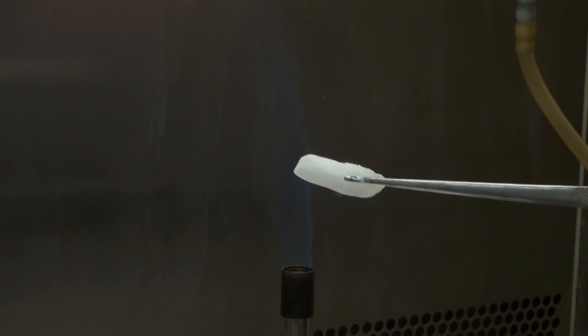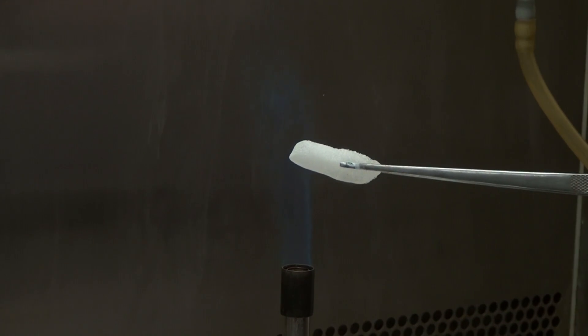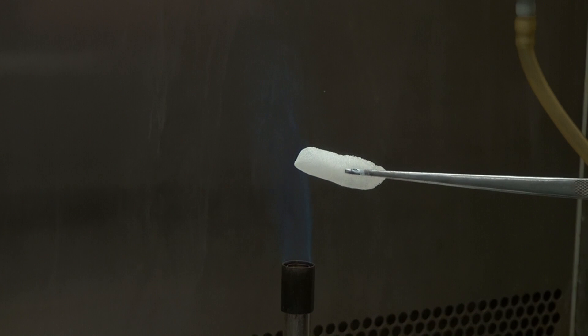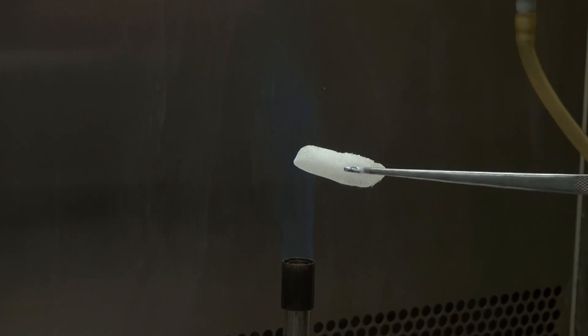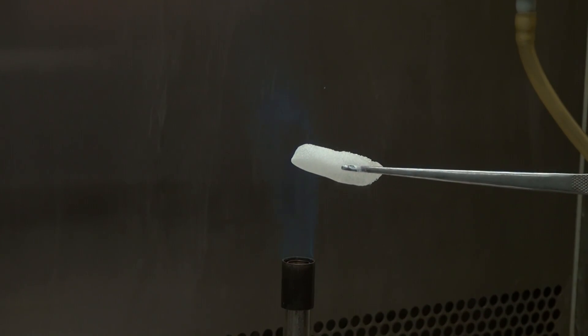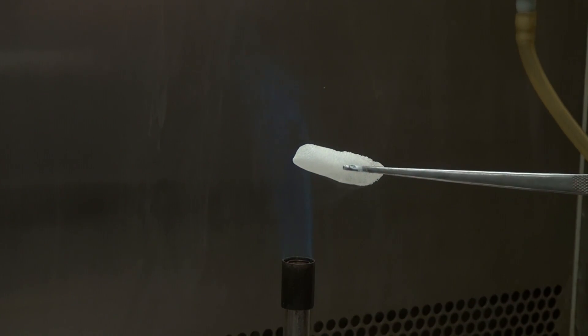If we shove dry ice into the flame of a gas burner, it still won't melt, but will simply sublimate faster.